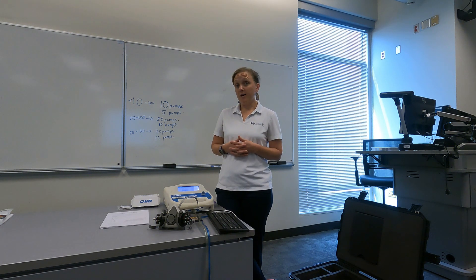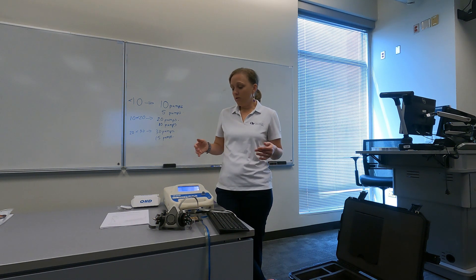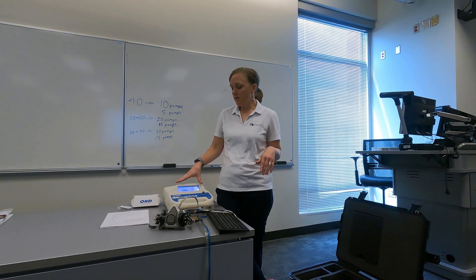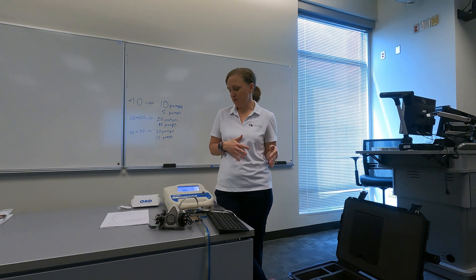The fit test itself is a much faster process. And what I really like is that during the fit testing process, the employee can actually see whether or not there's leakage from the respirator, which gives them an understanding of whether the respirator fits or doesn't fit.